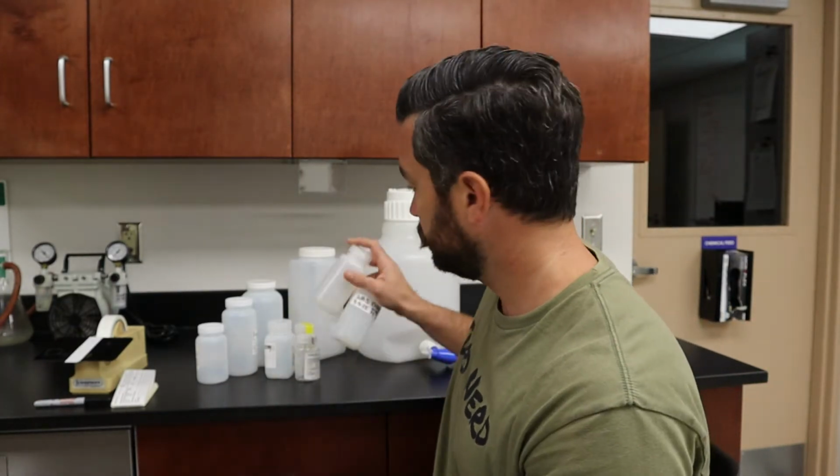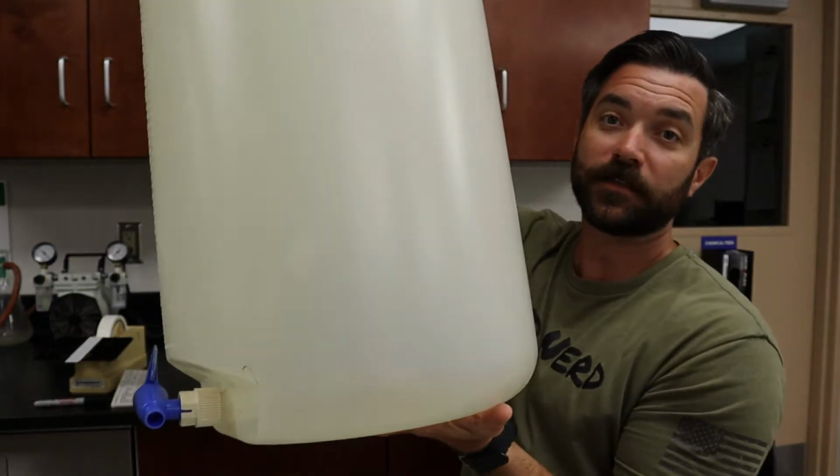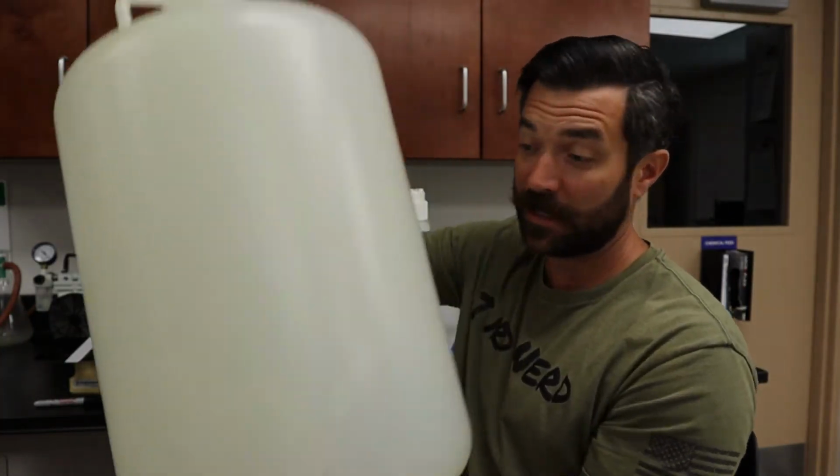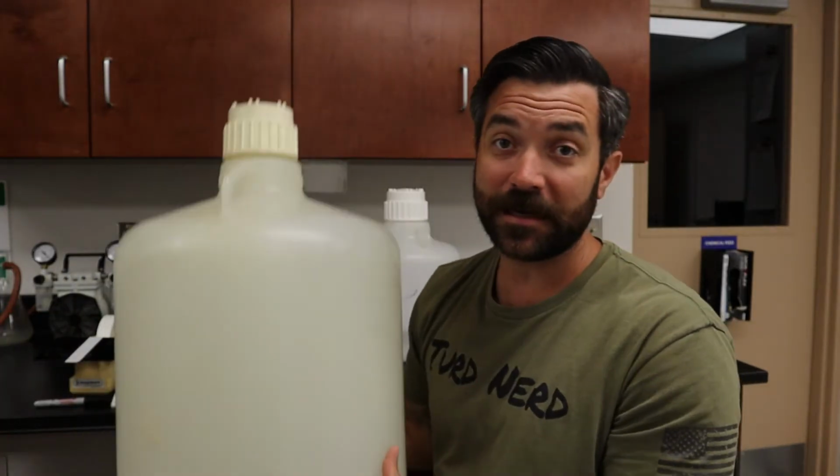One last note about these guys here. I almost forgot. Let me show you something real quick. That is a carboy. This is a car bus. I'm just kidding. It's not really called a bus, but it is humongous. We don't actually use this guy. It is just in our storage facility, and I pulled it out specifically for the video.